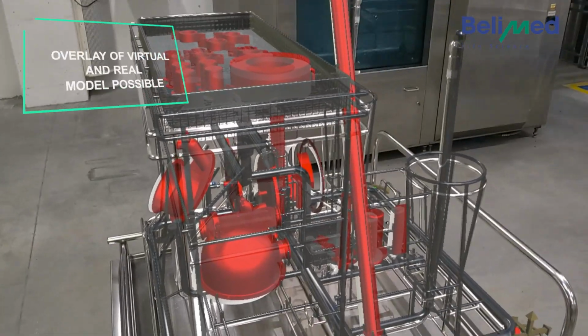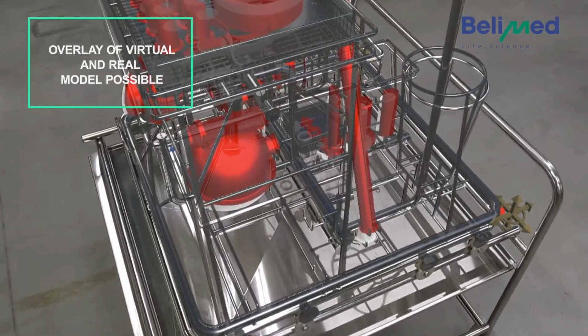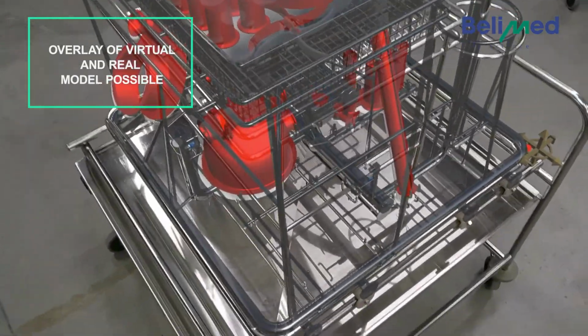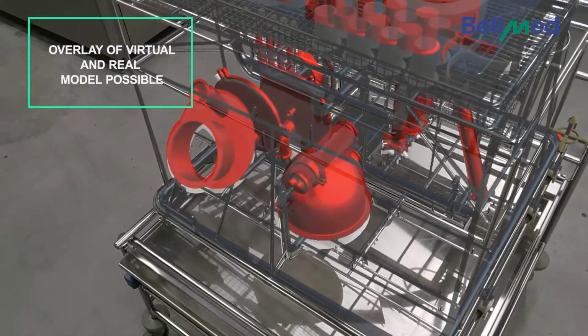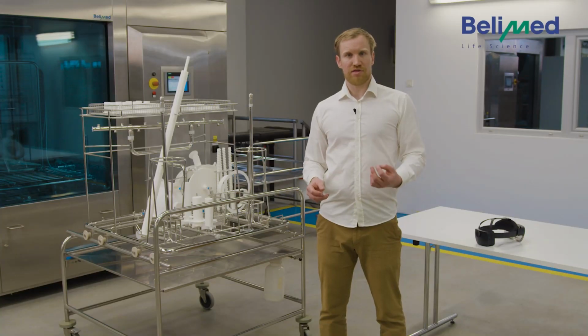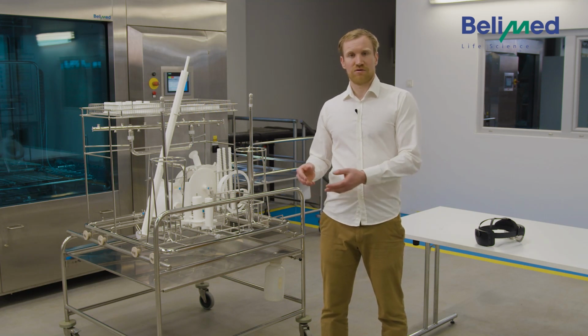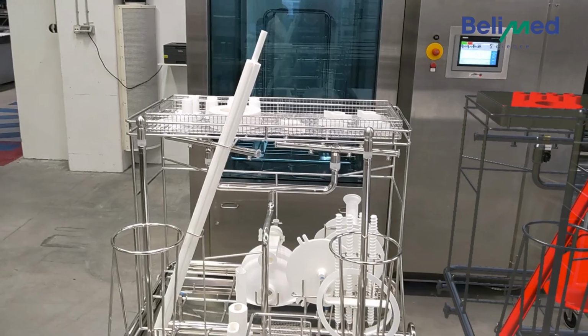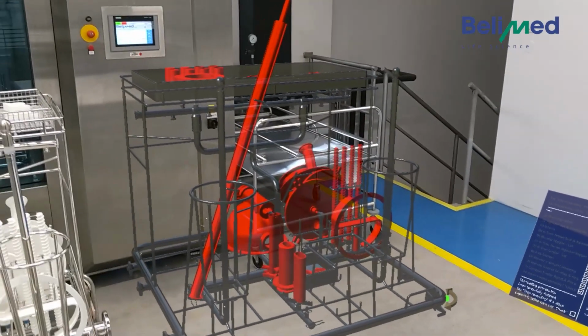Secondly, you can record what the person who loaded the rack has done and which can be saved together with the batch protocol. So afterwards, you have the whole data. So you can really check, was everything all right? Was everything recorded and loaded correctly? And after that, the washing process. So just having these glasses for the loading of a rack can benefit your whole cleaning process.